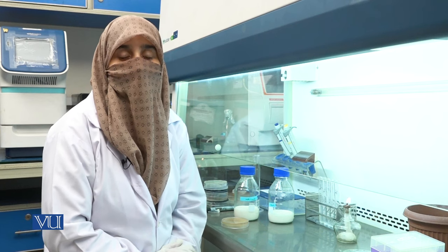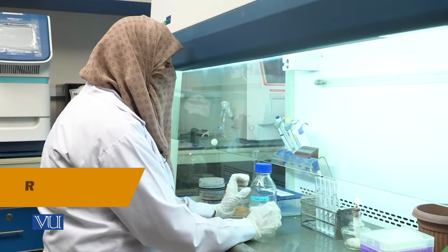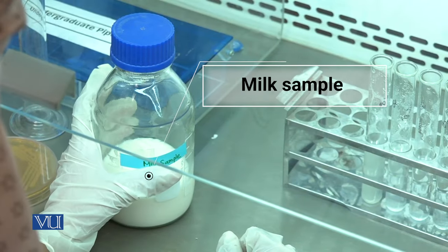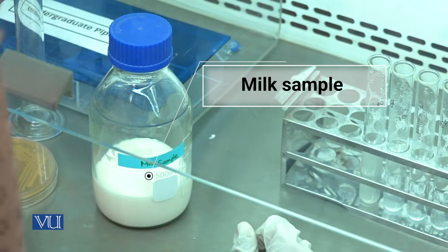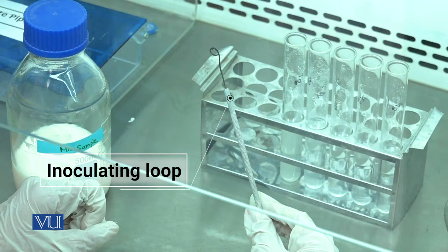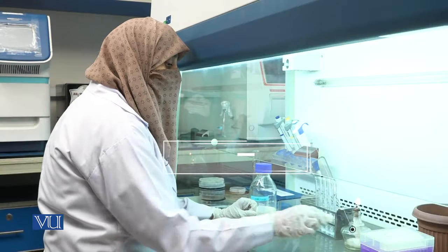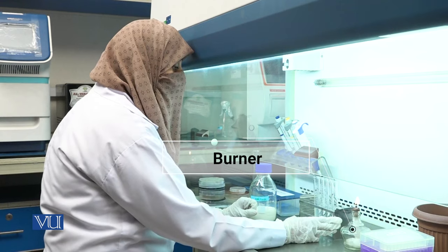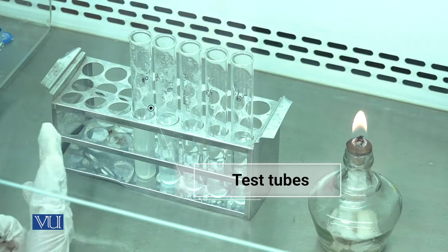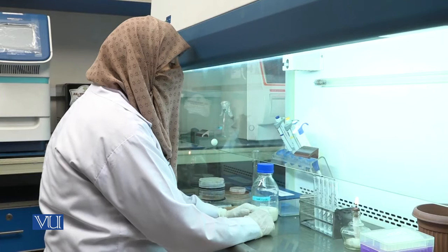For the preparation of the fermented product, yogurt, the following procedure is used. Reagents and Materials Required: milk sample, inoculating loop, burner, test tube containing sterile distilled water for serial dilution, and collect milk sample.